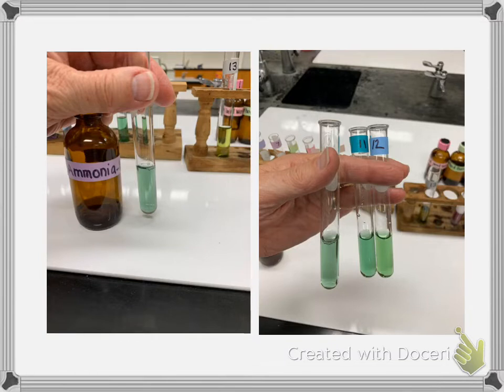so you can leave the digital meter column blank. And so this is ammonia, the first one on the left. And then you would be looking, here are the numbers, the first test tube is 11 and 12. If you think something is in between, you could estimate a 0.5. So it could be like 9.5, 6.5. But we can't really get more precise than that.